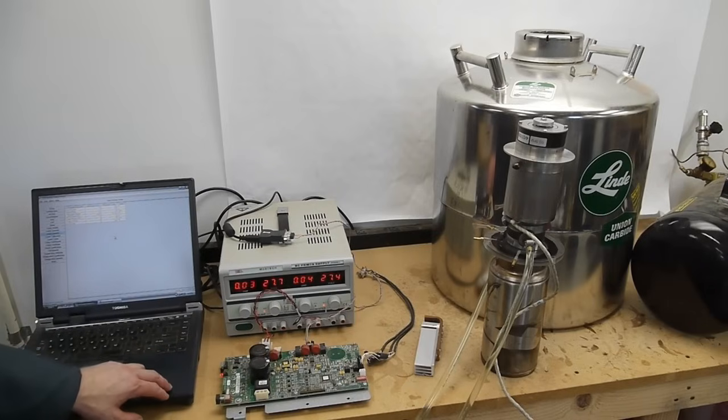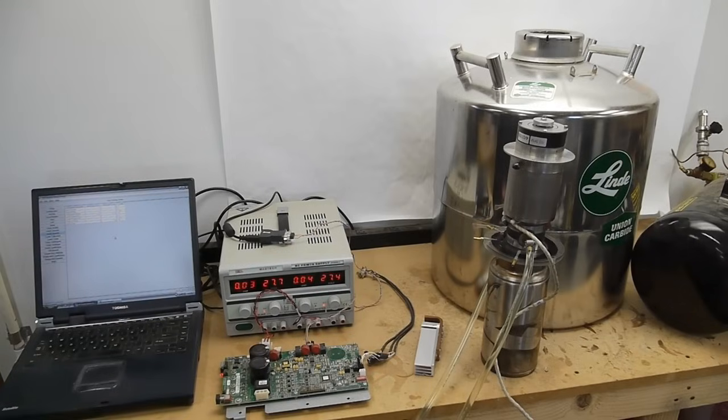However you can overdrive it and since I have the control software installed on my computer talking to the circuit board over a serial link I can download new firmware parameters to it and get the power up to maybe about 160 165 watts and it seems more than happy to run at that power level as well especially with the water cooling.